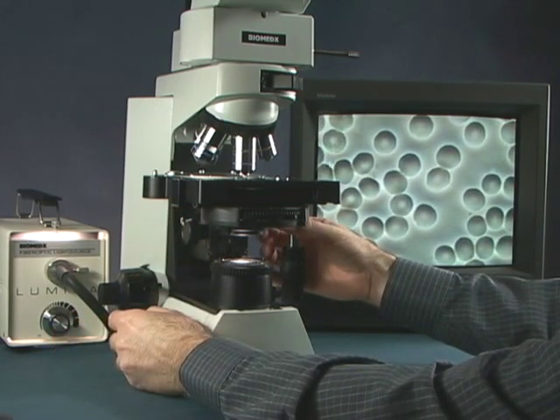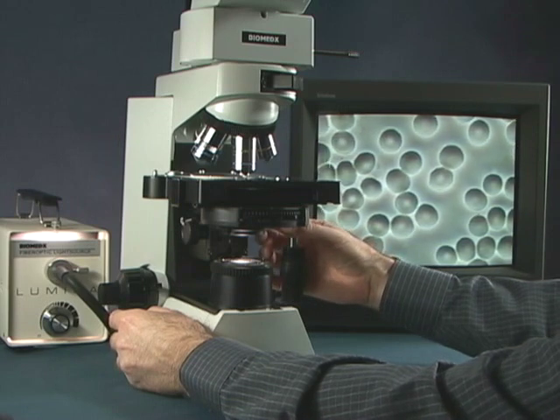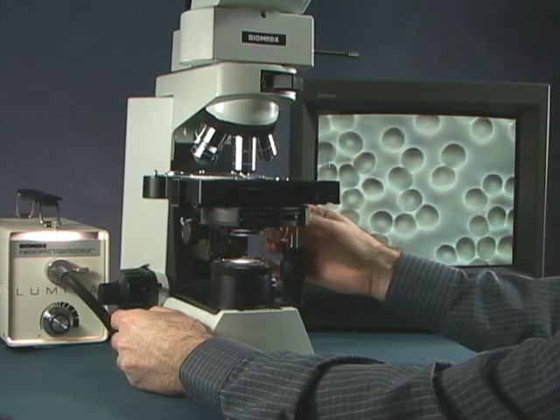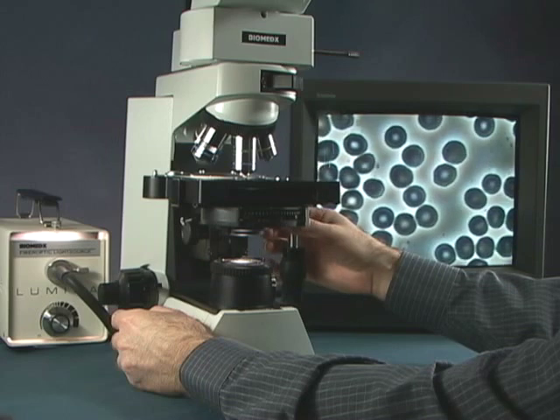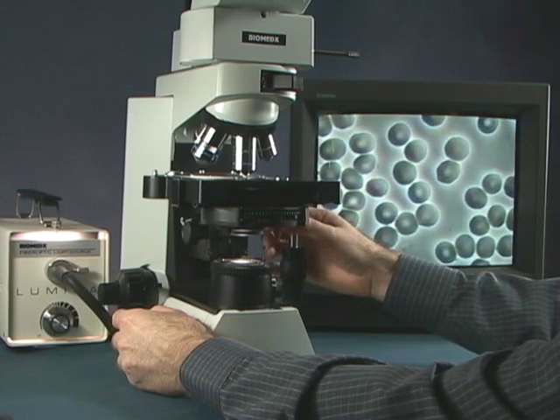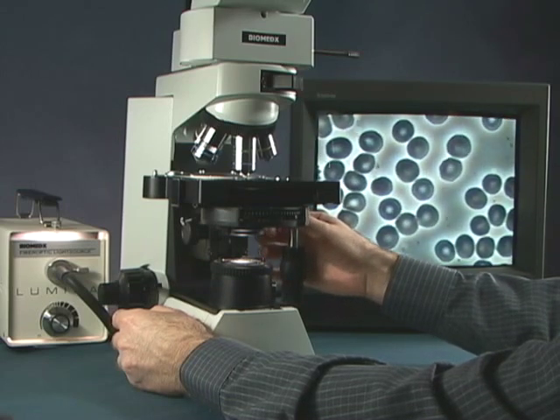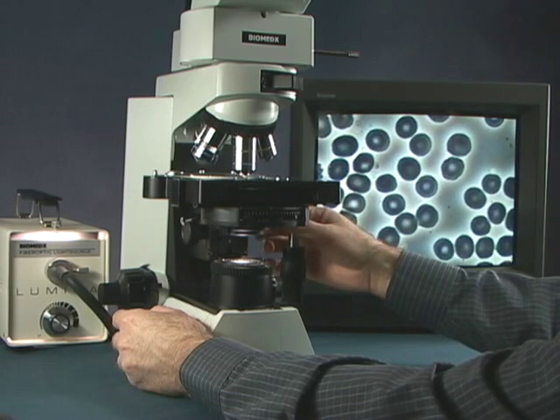So you push in one adjusting screw and rotate it one way and then you rotate it the other way. And what you are wanting is to get close to where you should be.